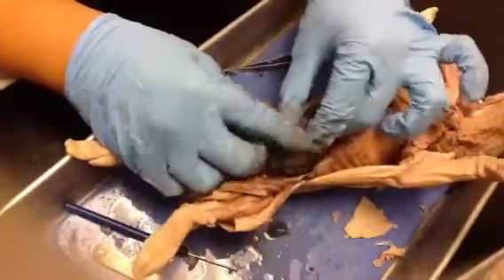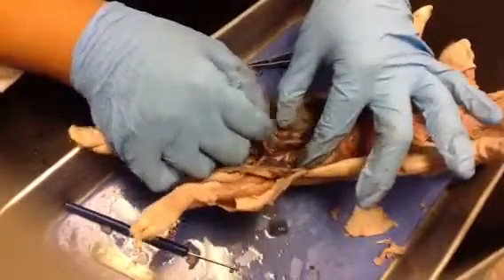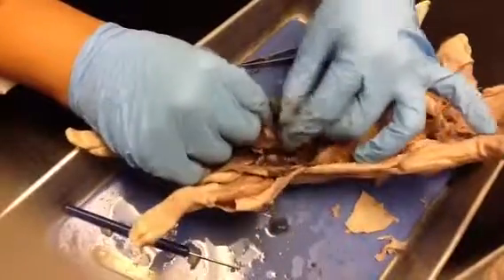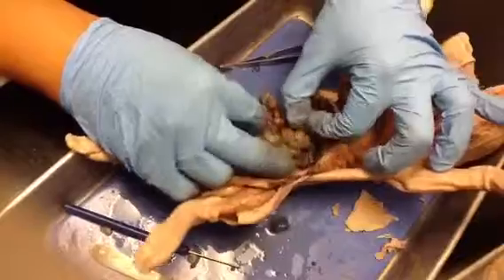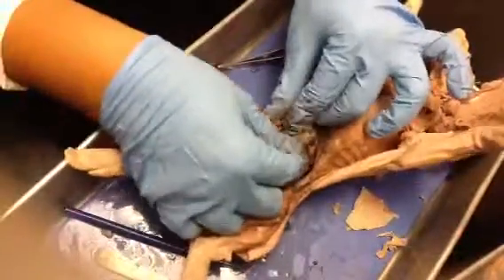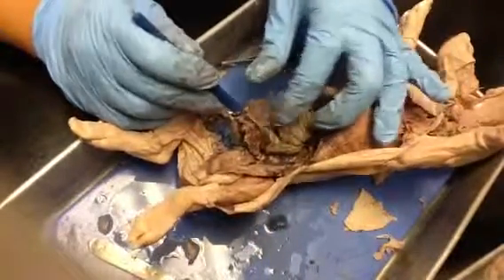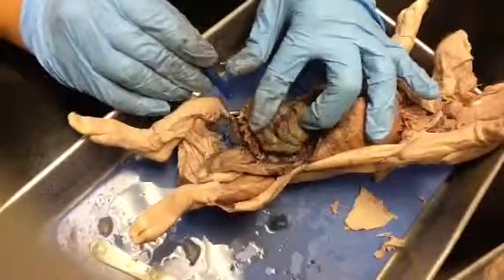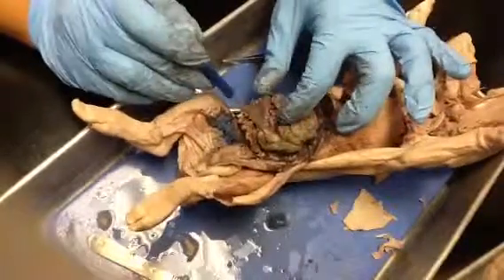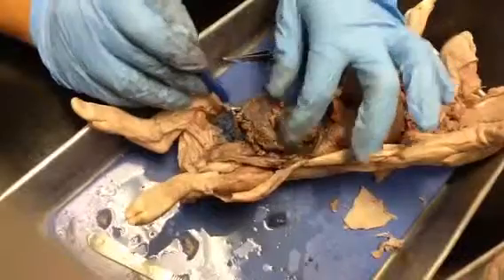Now, this is the large intestine. This is the spiral colon of your pig. But I want you to note, this is still your small intestine. This is the end of your small intestine, right here. So this would be your ileum. This is the cecum. Notice that enlarged area right there. That's your cecum. This here that sticks down is the appendix. So this is the ileum, this is the cecum, and this is the appendix. Do you see that?